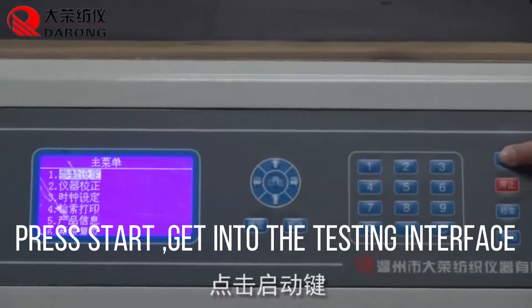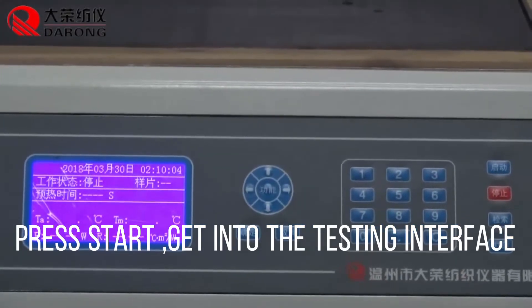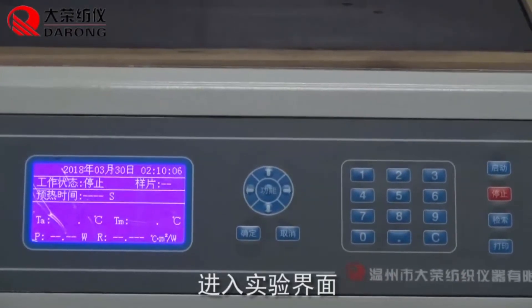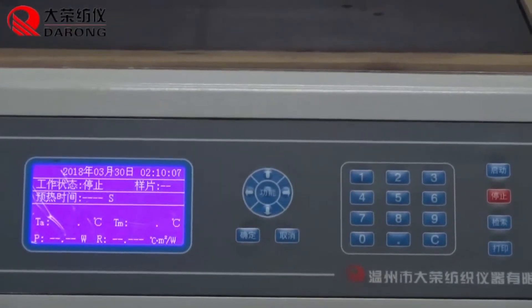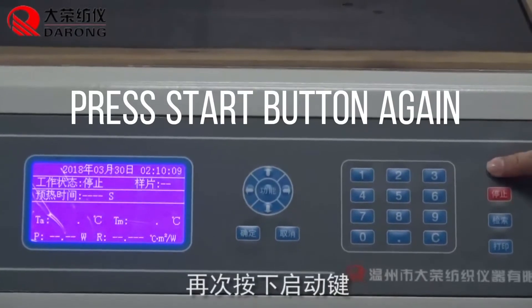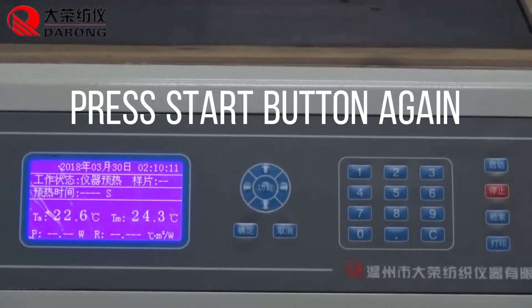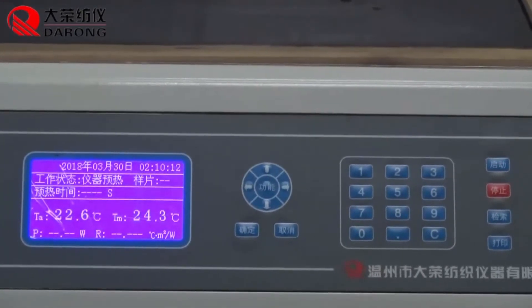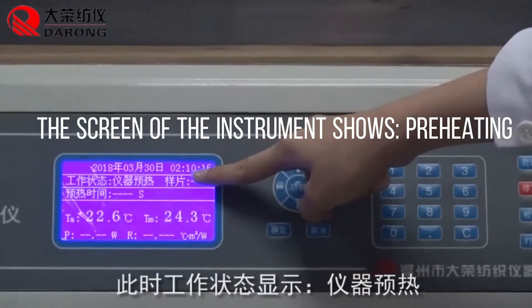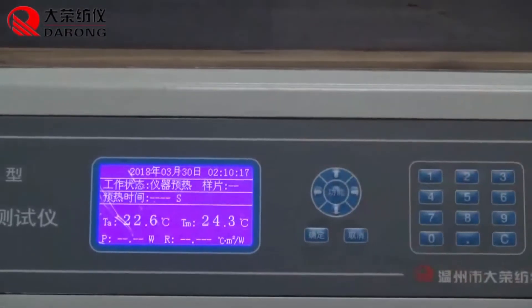Press start to enter the testing interface. Press the start button again. The screen of the instrument shows preheating.